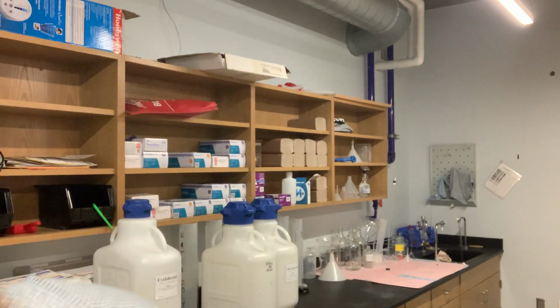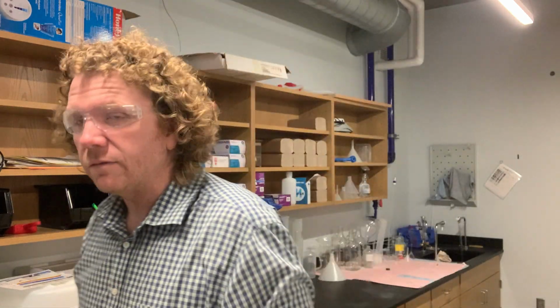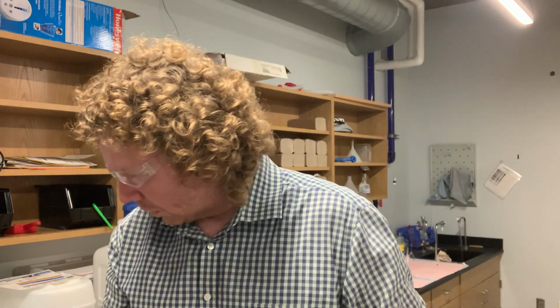Just as an example, you'll have a copper sulfate solution, blue, and then you'll have a zinc chloride solution, kind of a chalky, relatively insoluble solution. All of these metal-containing solutions, all of these ionic compounds, the copper sulfate, zinc chloride, nickel sulfate, I want you to mix those with sodium hydroxide and mix them with HCl. And I want you to basically observe, does anything happen? Does something precipitate out of this? And if the answer is yes, what is that thing?